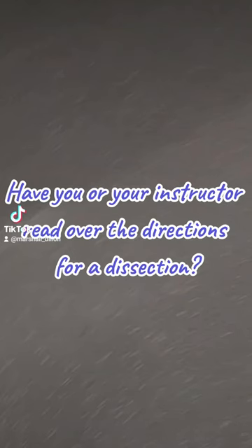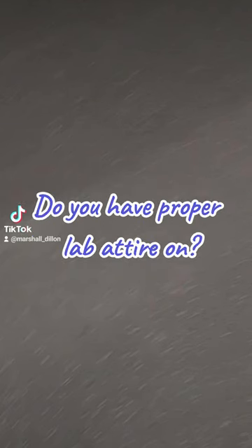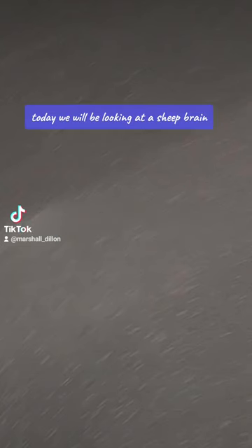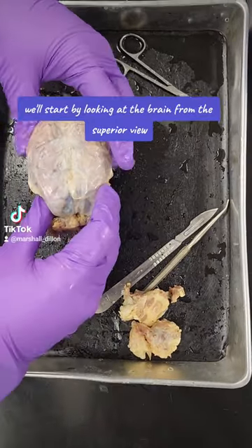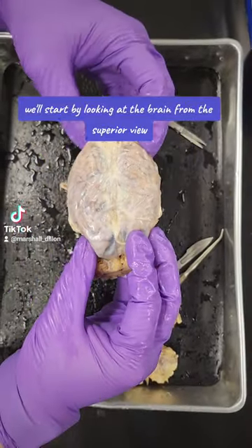Have you or your instructor read over the directions for a dissection? Do you have proper lab attire on? Alrighty, let's get started. Today we will be looking at a sheep brain. We'll start by looking at the brain from the superior view.